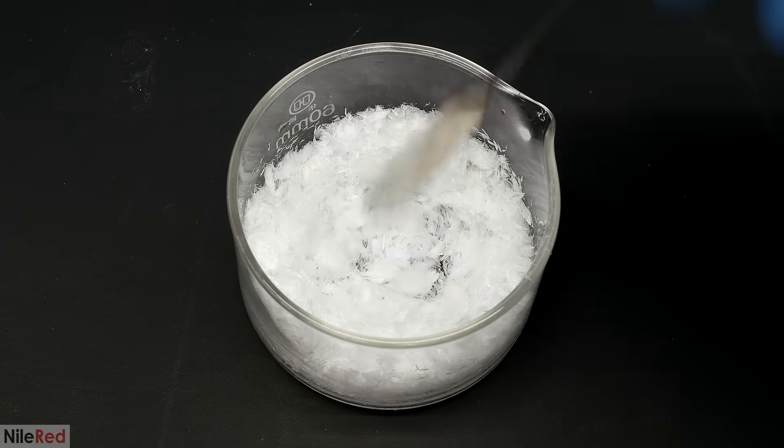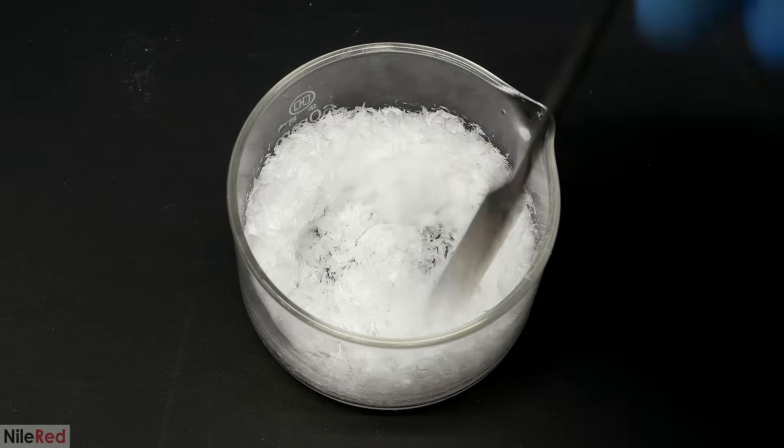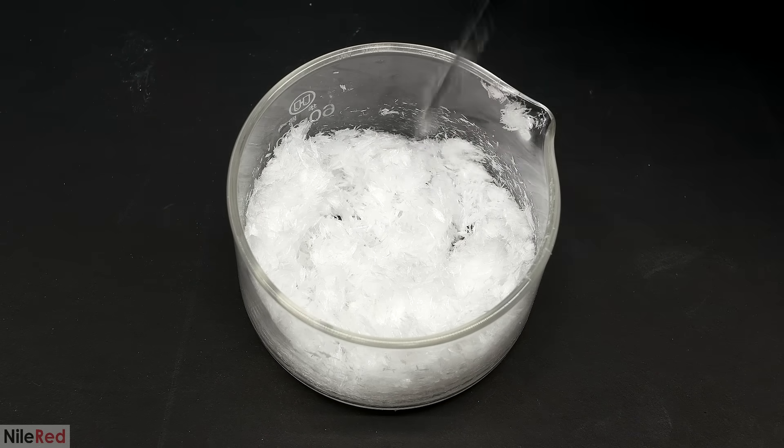Even after 30 minutes on the vacuum filter, the crystals were still a little bit damp. To fully dry it up, I put it in a vacuum desiccator for a couple days.